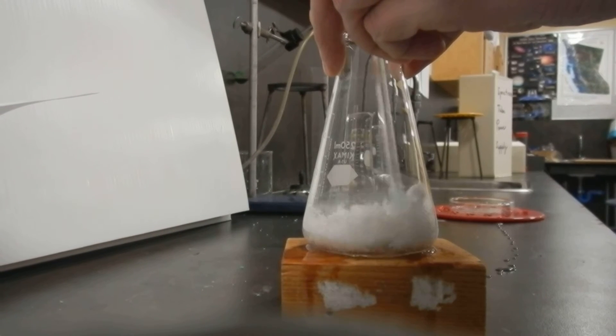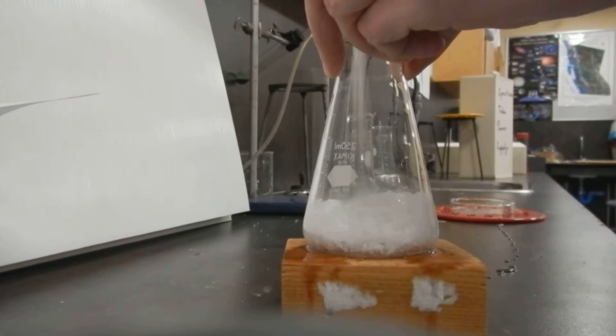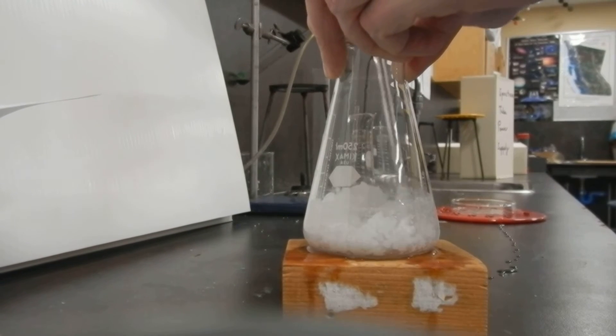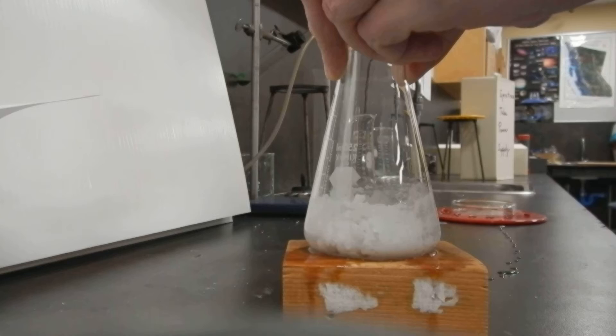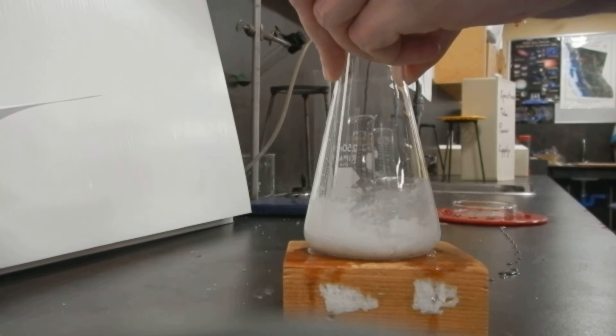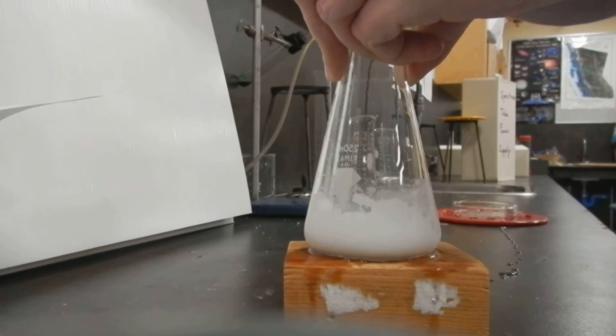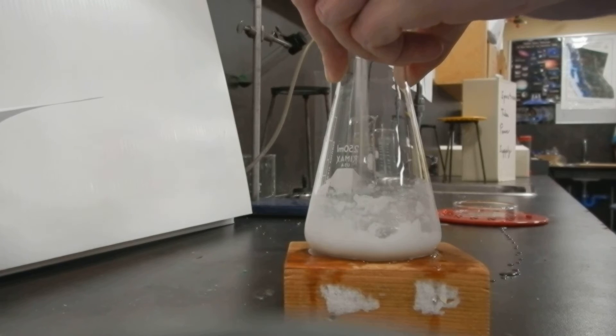So we're looking for some evidence of a chemical change. And one of the pieces of evidence you won't be able to detect is this stuff stinks.